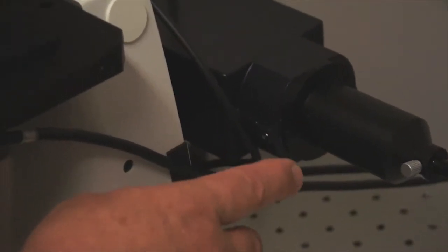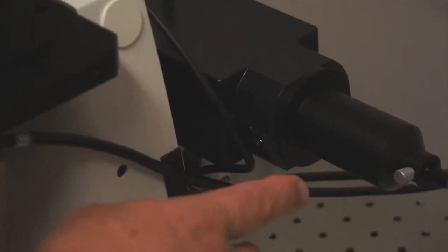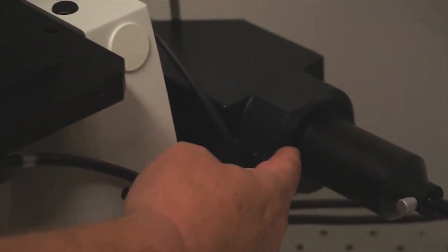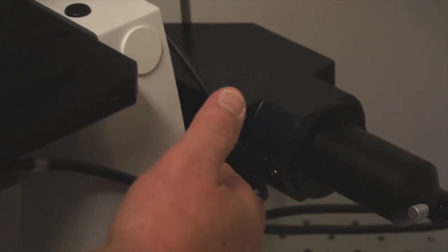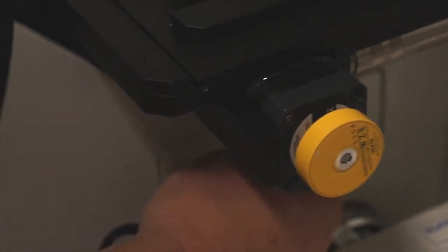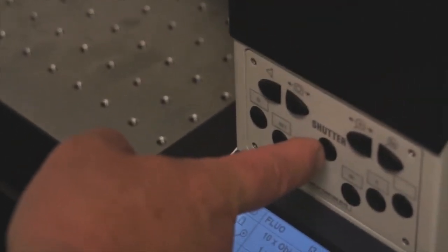Now that our illuminator for epifluorescence is turned on, we're directing light through the waveguide and into the epi-illuminator of the microscope. The light comes down through the body of the microscope and travels through a filter pack built into the body. We can send that light to the specimen by pushing on the shutter button, and here you can now see that the light is illuminated on our specimen.